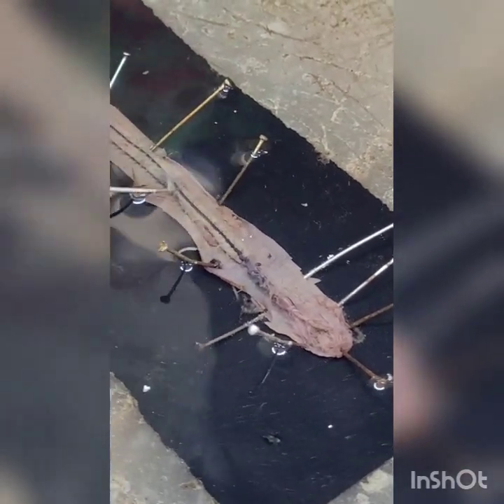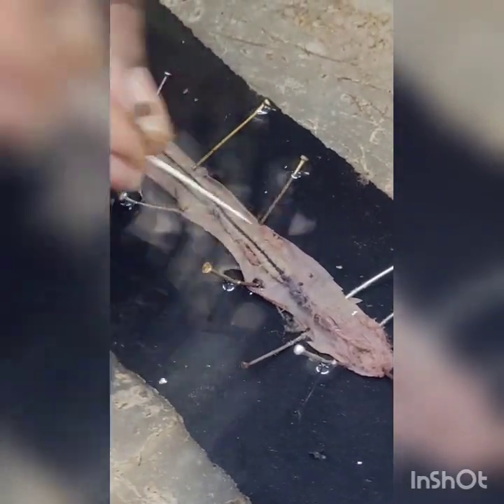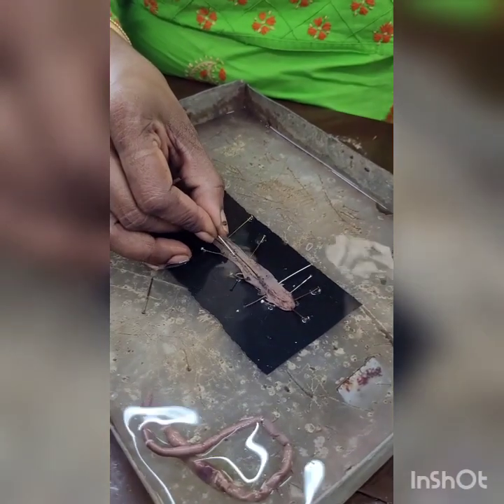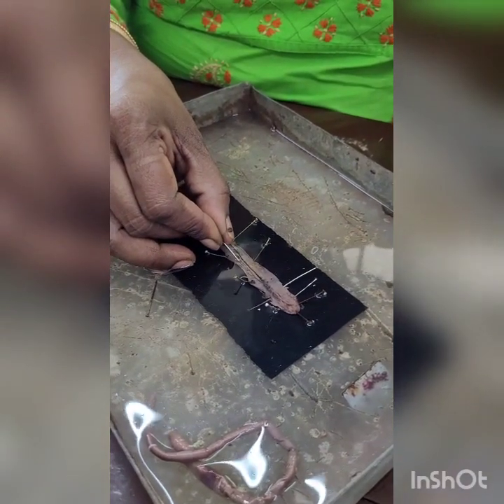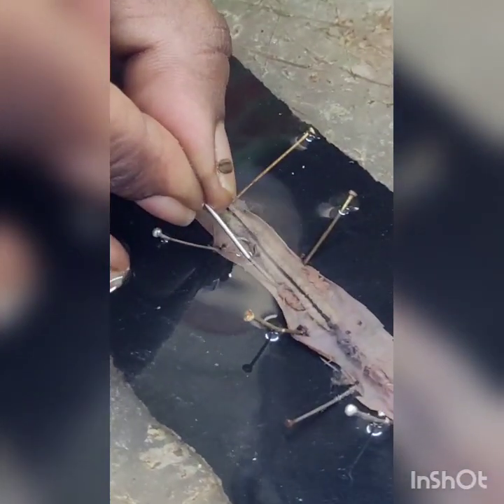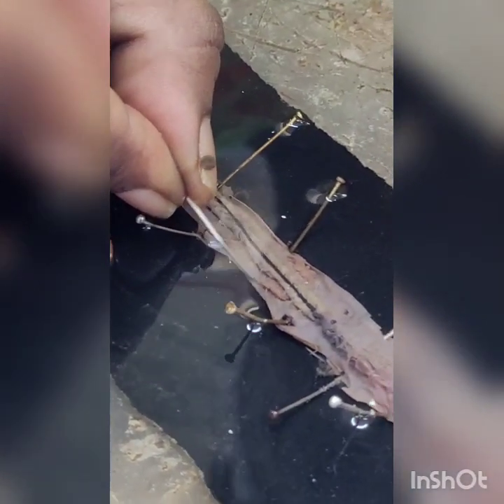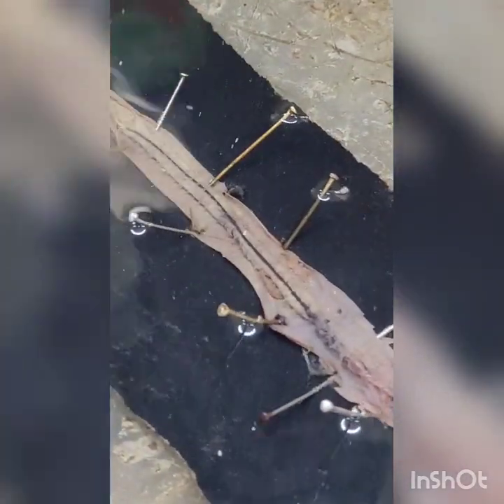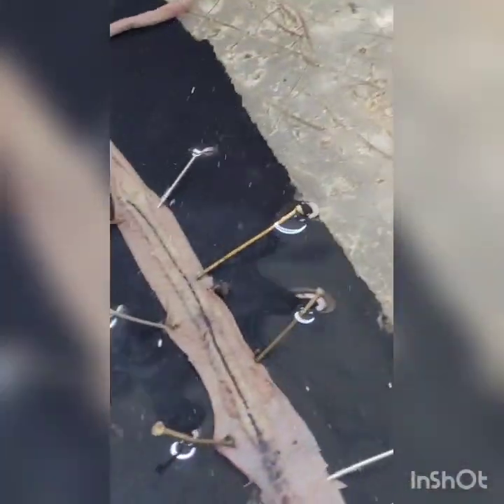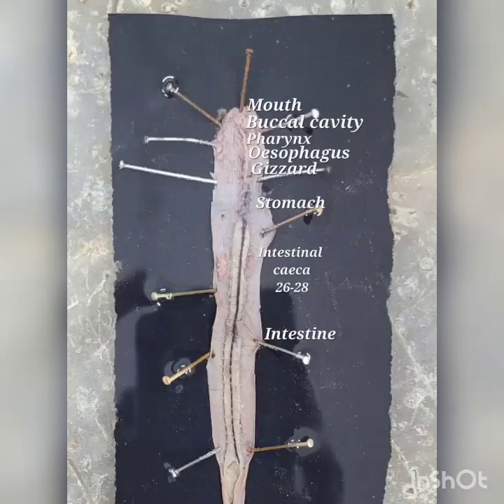From the 15th segment onwards is the intestine. You can see the intestinal caeca present at the 26th, 27th, and 28th segments.